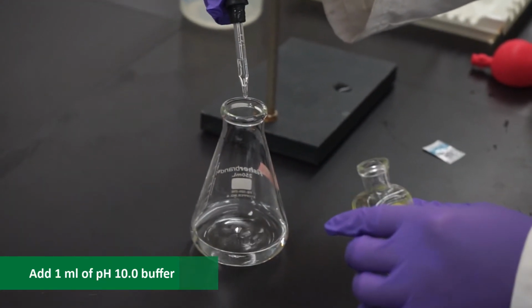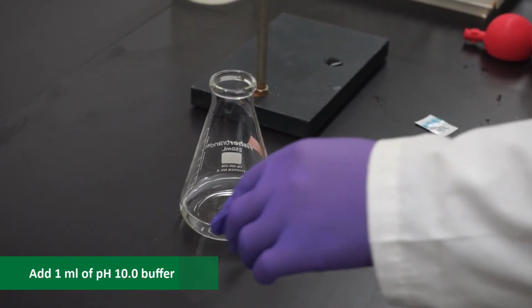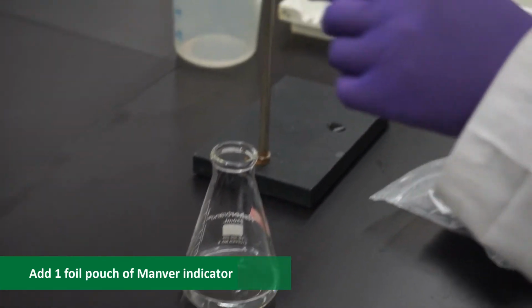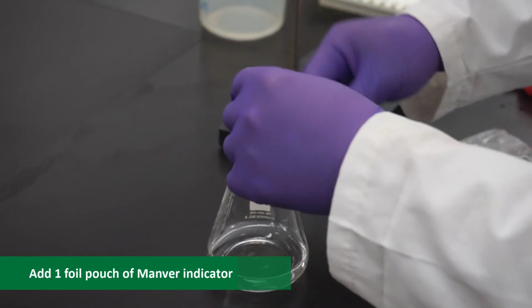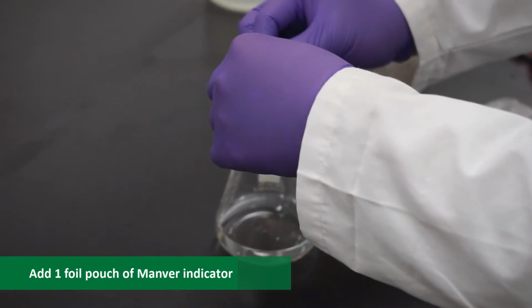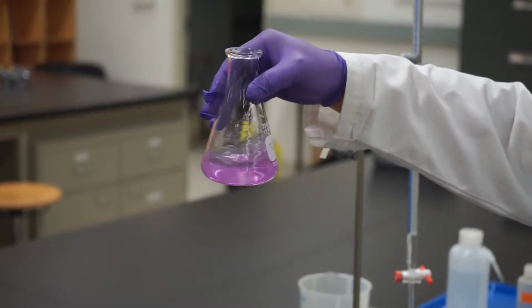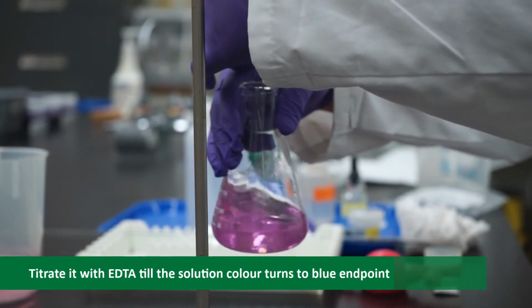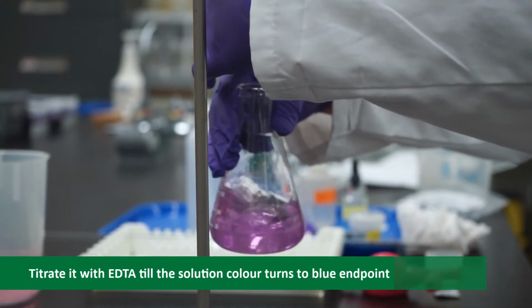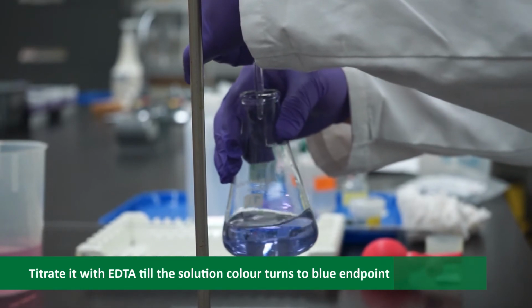To find total hardness, add 1 ml of pH 10.0 buffer and add 1 foil pouch of ManVer indicator and shake it. Now titrate it with EDTA until the solution color turns from red to the blue endpoint. Write down the final EDTA volume.